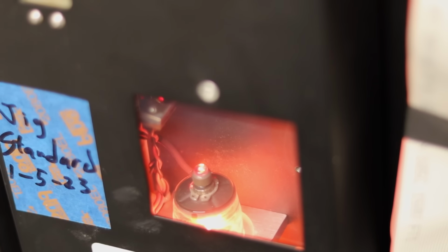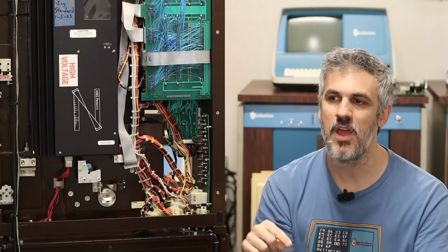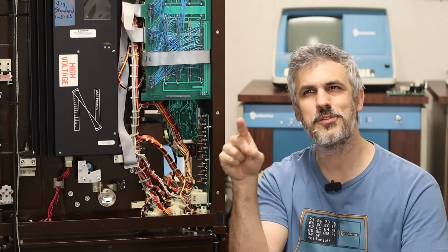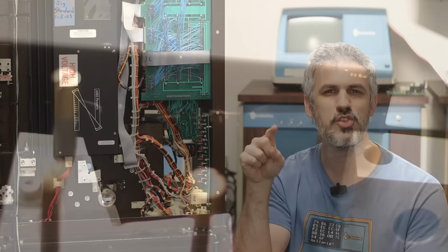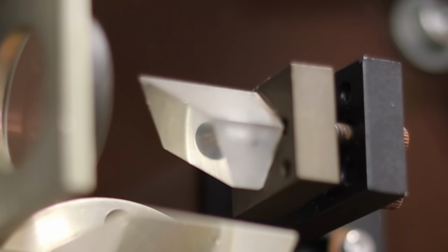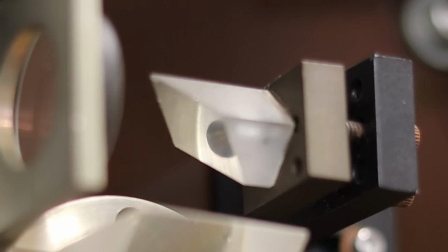So when the laser comes out of the laser tube here, it is of course the tiny little pinpoint of light that you would expect out of a laser. But after that, we beam expand it, then collimate it into a about 2 to 3 centimeter or a 1-inch square. So you have this 1-inch square coming out of the bottom of the box here. It strikes this piece right here, which chops a corner of that out. So you end up with a little Tetris block of laser light.